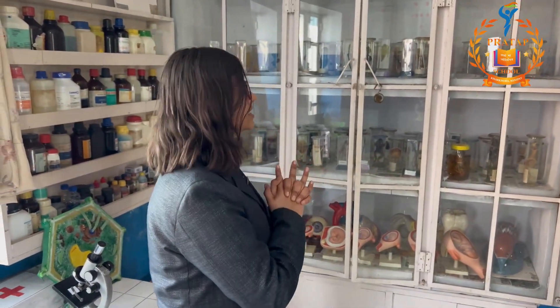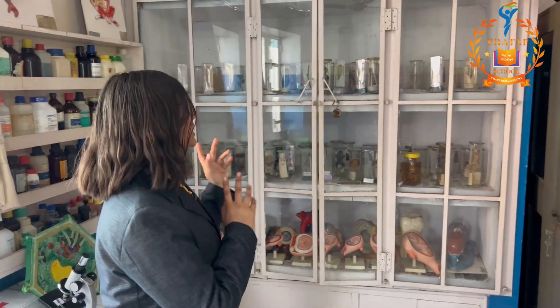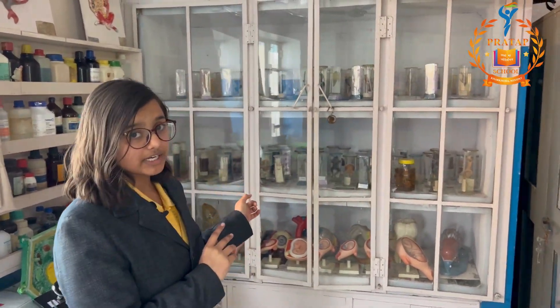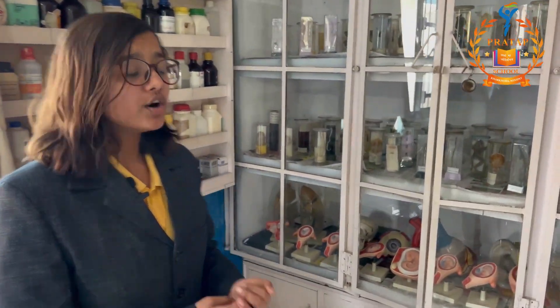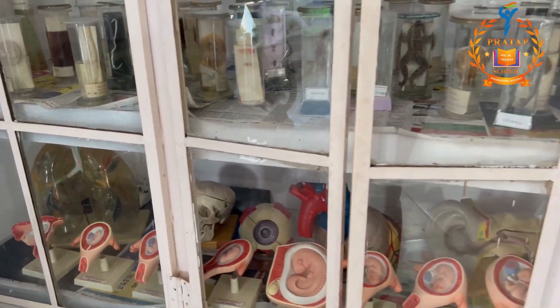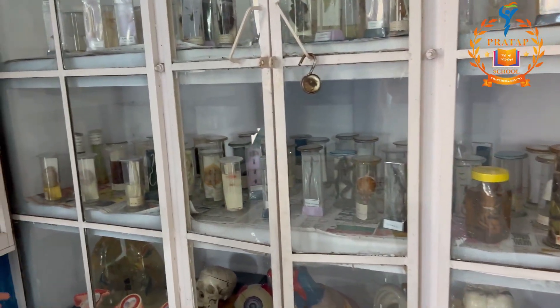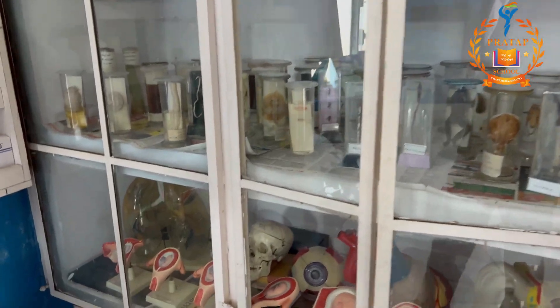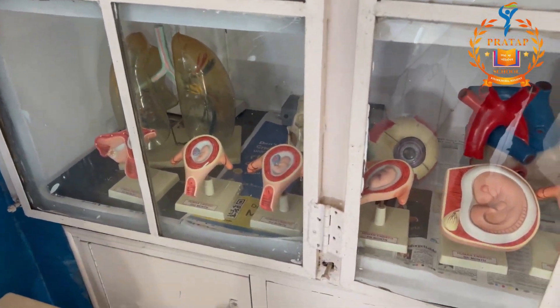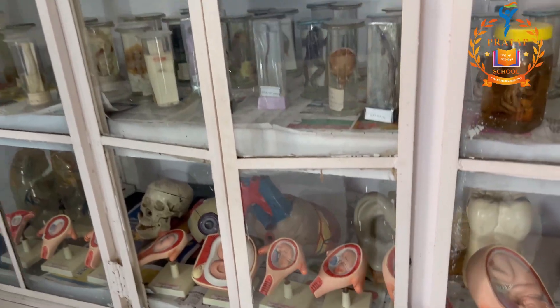Next up, we have the space where specimens of different plant and animal species are kept, both terrestrial and aquatic. We also have 3D models of lungs, skull, eye, heart, ear, and teeth. Next up, these are the 3D models of embryonic development during the gestation period, so that students can actually see what they cannot see otherwise.